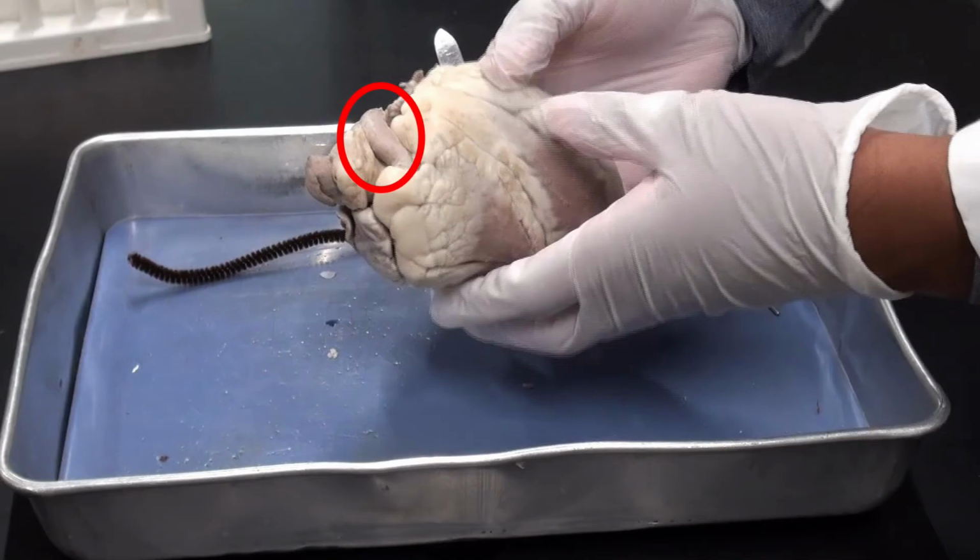Blood is moved from the right ventricle via heart contractions up towards the pulmonary arteries, which direct the blood towards the lungs, where the blood can then be oxygenated and eventually returned back to the heart. So here what I have circled in the red circle is the pulmonary artery, or at least one of them, that goes towards the lungs.